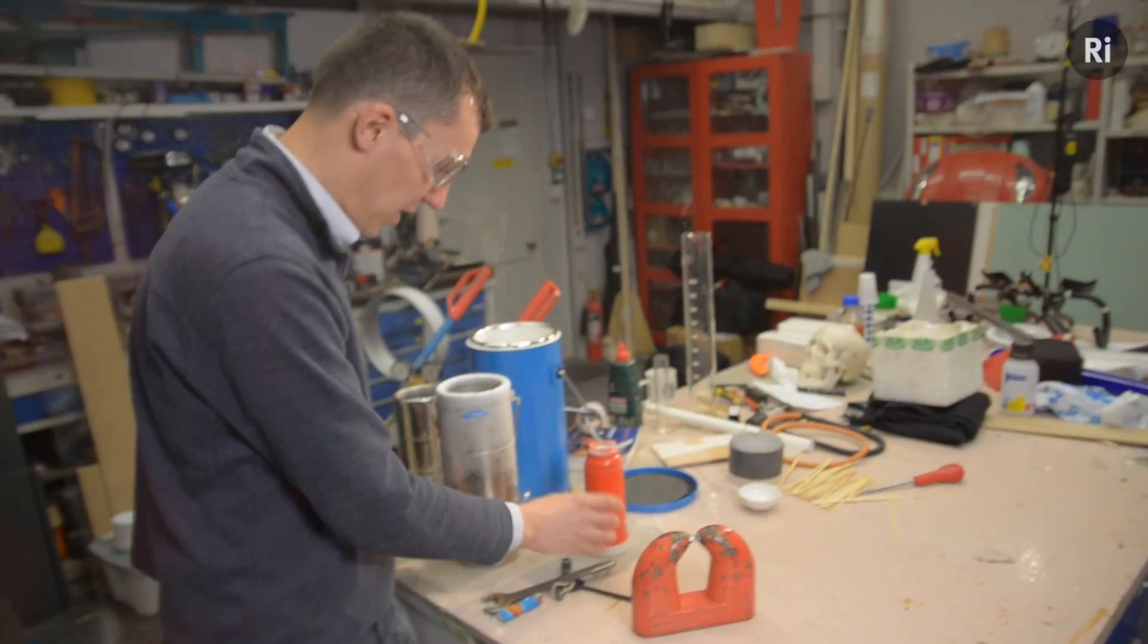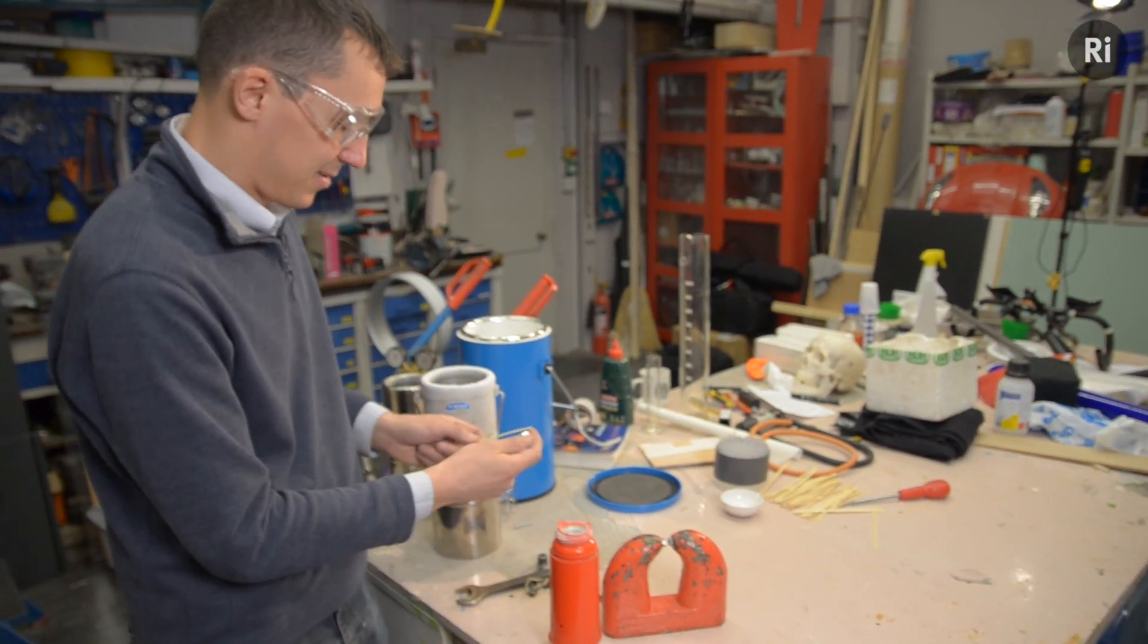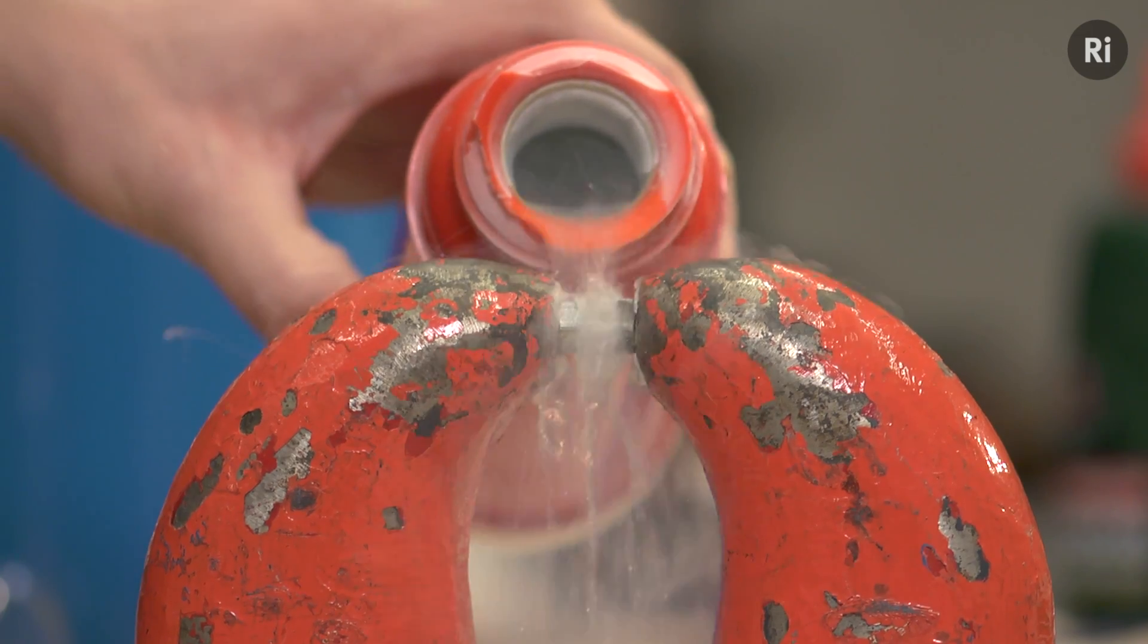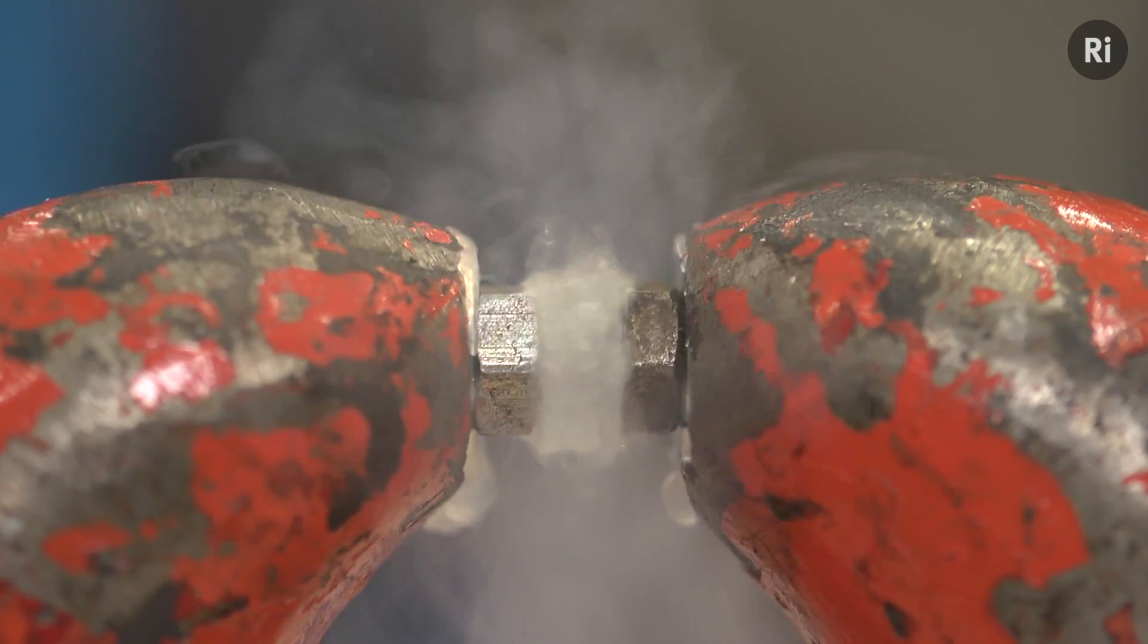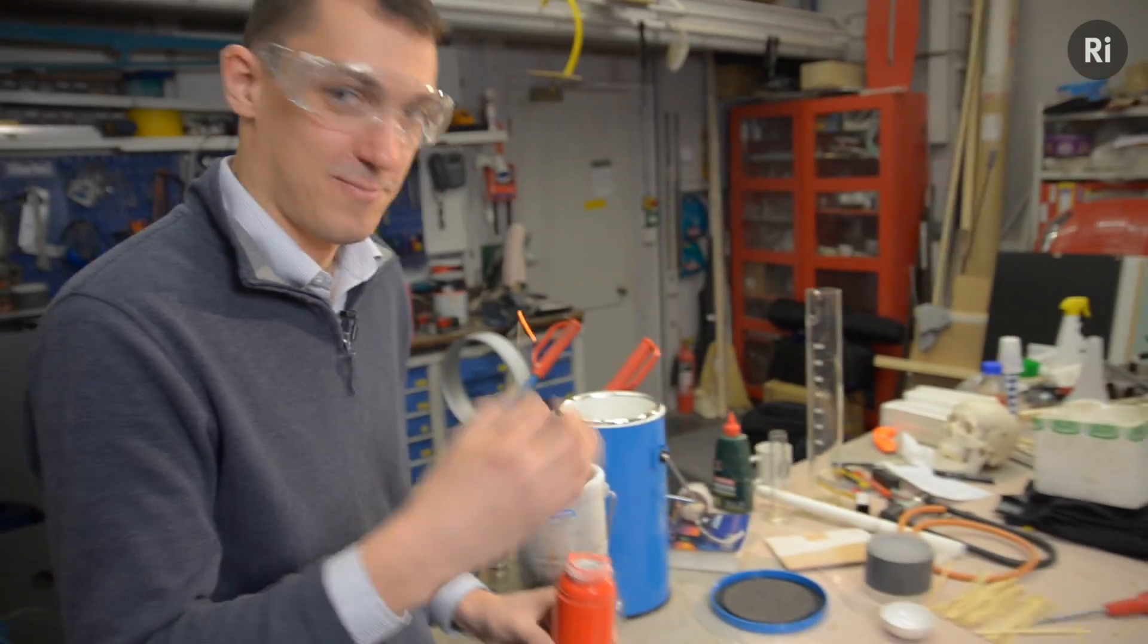So one final thing, seeing as this is liquid oxygen and this is the Royal Institution, I'm going to set something on fire. This is the classic demonstration of oxygen, relighting a glowing splint. Lovely. Thanks very much.